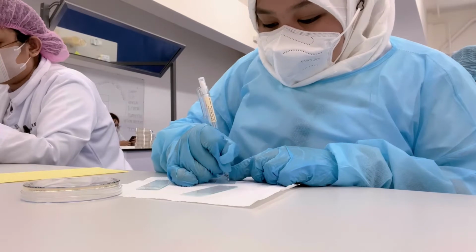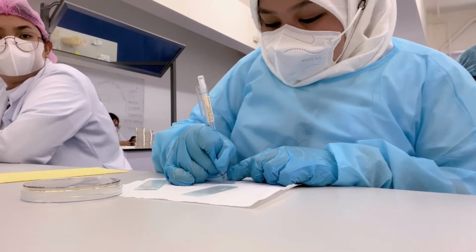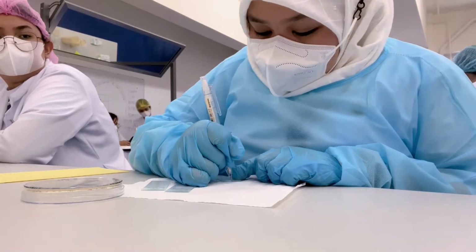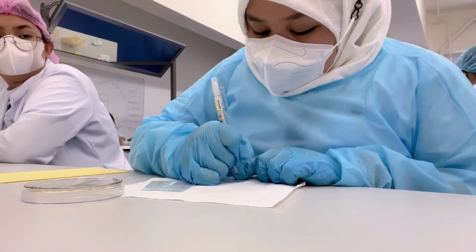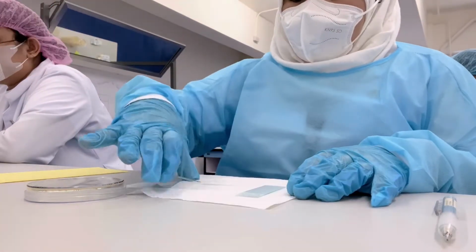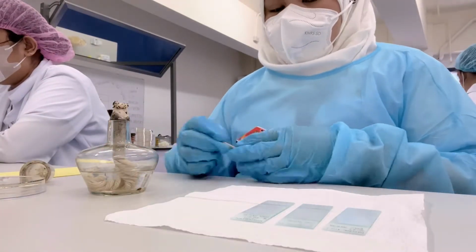It is important in the laboratory to label the specimen, materials, and even reagents to avoid errors and cross-contamination. And also, it will help the medical technologists to release reliable and accurate results. The first step in gram staining is to prepare the smear.